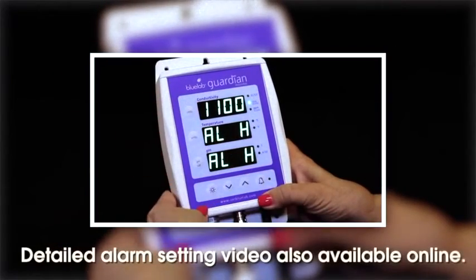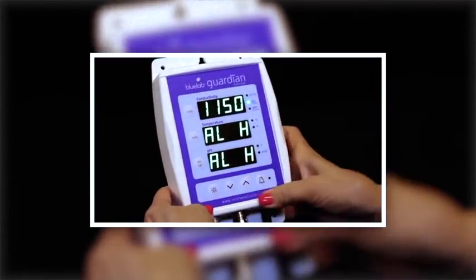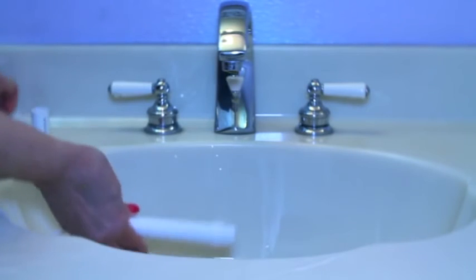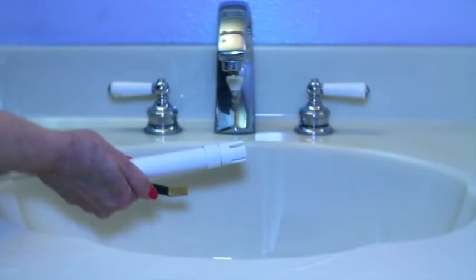If you wish to manually input high and low alarm settings, watch the Guardian Monitor alarm setting video. Remember, if you're taking measurements from different solutions, always rinse each probe using clean tap water to remove traces of nutrient solution to ensure accurate readings.